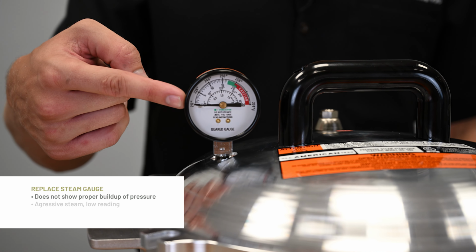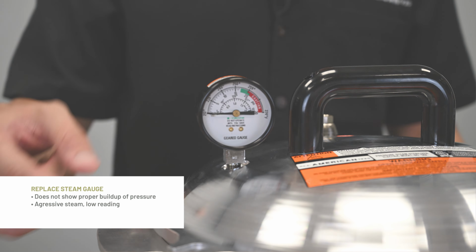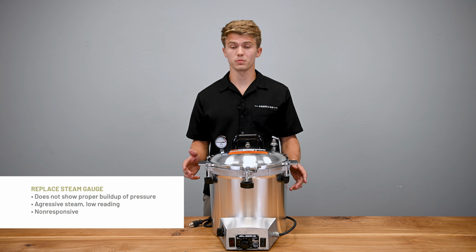Additionally, during use, if the gauge does not match the operation that you are performing, it may need to be replaced. For example, the gauge does not show proper buildup of pressure during the heat up period, steam is venting aggressively and the gauge is reading low, the gauge is completely non-responsive, or the gauge is not properly returned to zero after the cool down period. A good practice is to replace the steam gauge yearly.